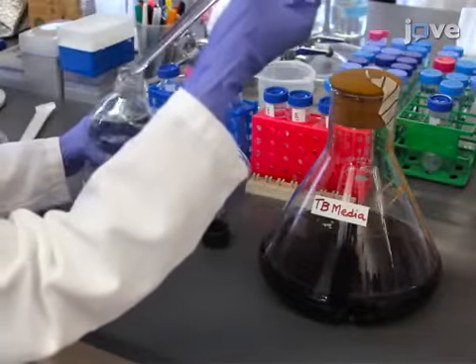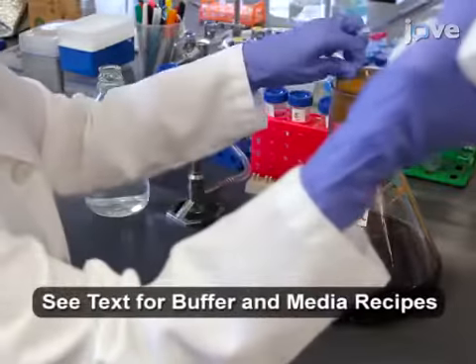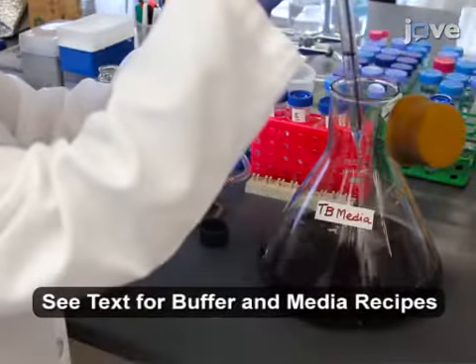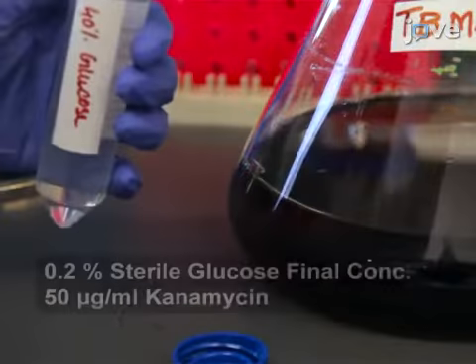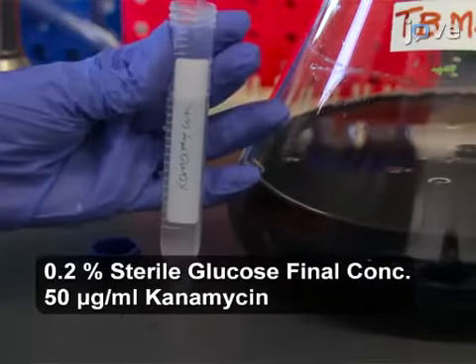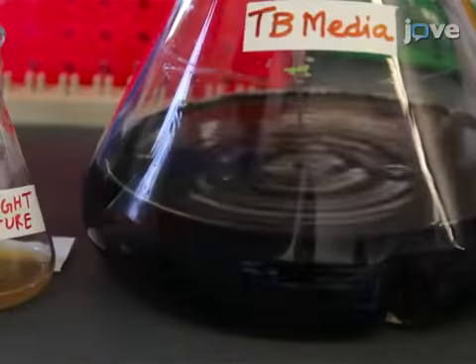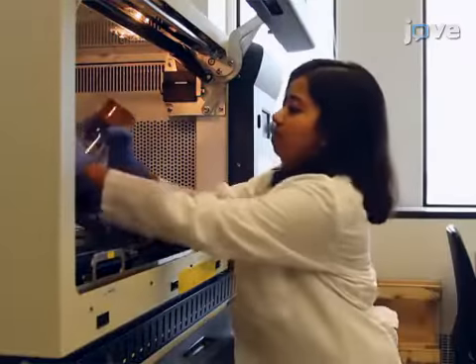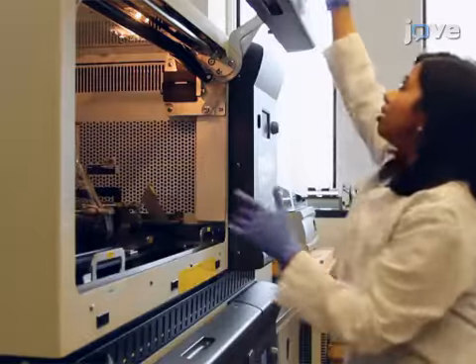Next, add 100 mL of sterile potassium phosphate buffer to the autoclaved Terrific Broth Media. Then add sterile glucose, kanamycin, and 10 mL of the overnight culture. Incubate at 37 degrees Celsius in a shaker at 250 rpm.